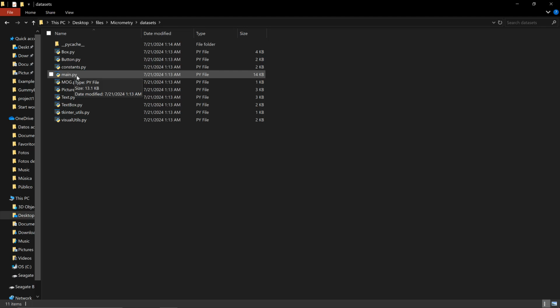The most important script, which is actually the script that you're going to need to run in your computer, is called main.py. But you will notice that if I click on it, in my case, it doesn't open. And the reason why is because my version of Python is being handled inside of a virtual environment that has been created by a program called Anaconda. So let me guide you through the different steps of how to create an environment.